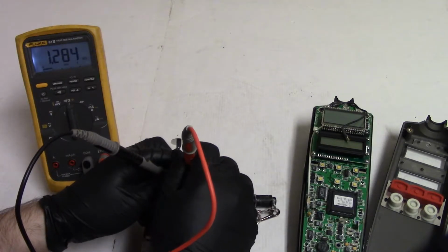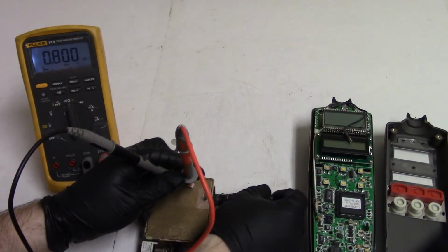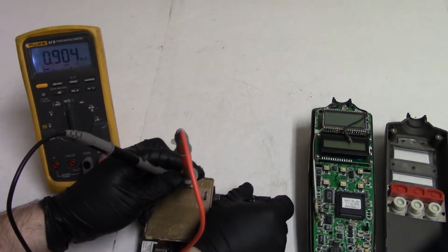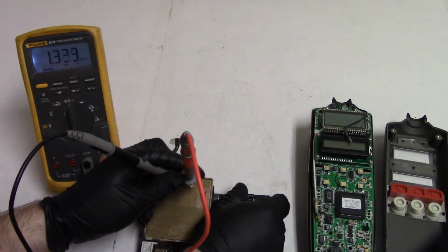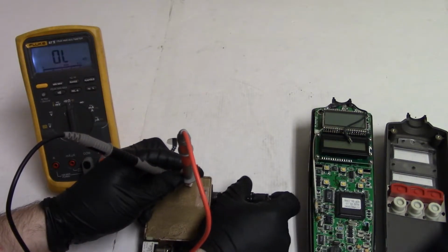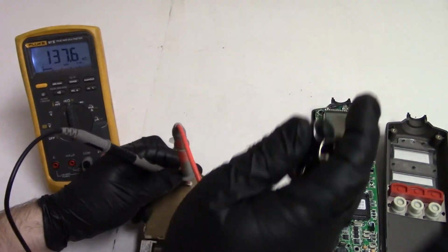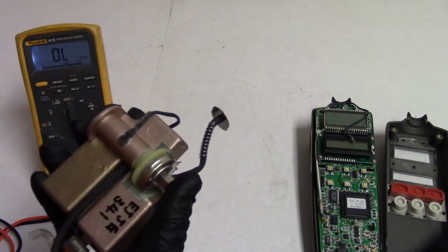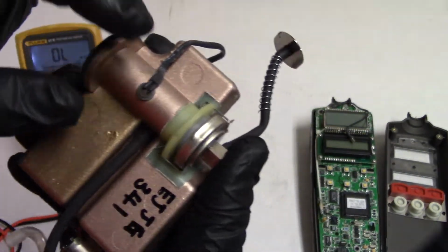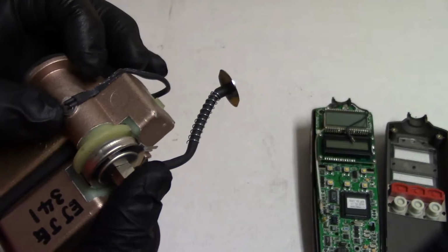Down to 1.2K with that visible light. So if we turn it off, it goes up to meg. Wow, that's a really wide range sensor. So 1.1 meg to 1.1K using a flashlight. So that's what that is. That is a photocell of some sort, that thing right there. I'm not going to pull it out. It's kind of glued in there.